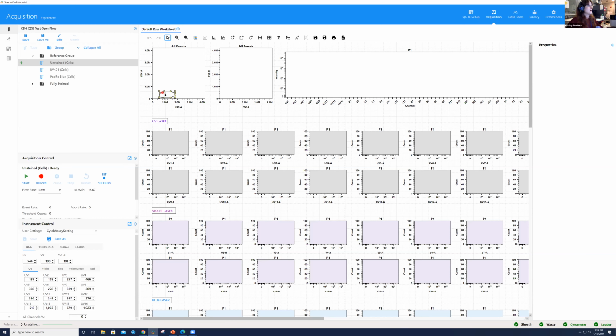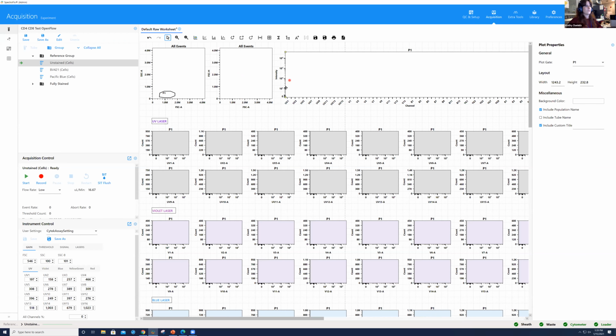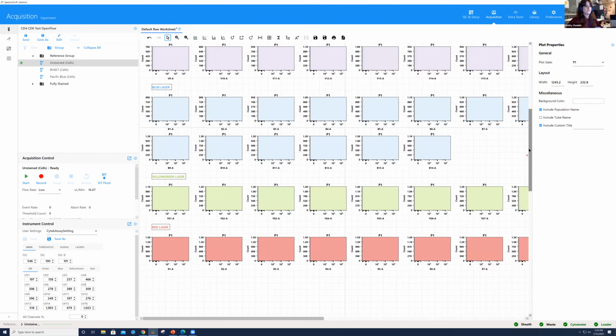I automatically have in this worksheet a scatter plot that has this P1 gate, like I mentioned before, which is debris exclusion. We typically have it set up where our second plot is our forward scatter height versus area. And then we have this full spectrum plot, which shows us all the detectors versus intensity. You can think of it like many, many histograms, or all of the detectors as histograms on their side. That's a nice way to view it. And then we also have all of the histograms here.